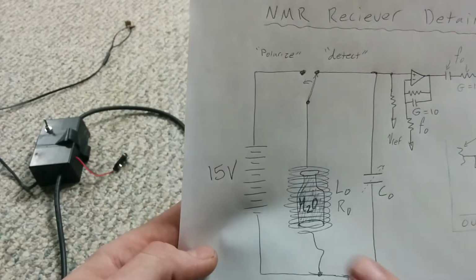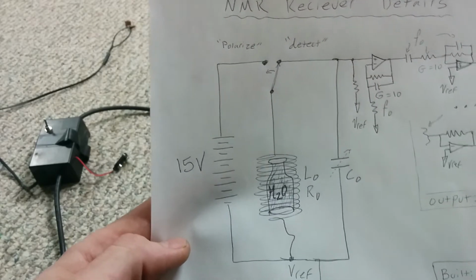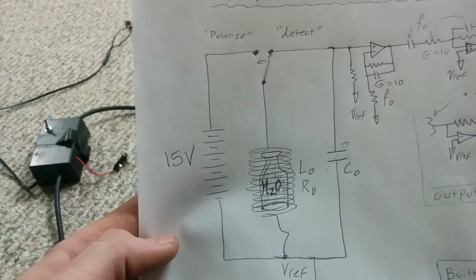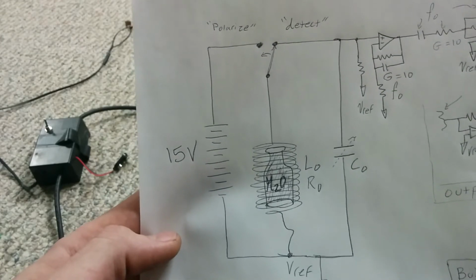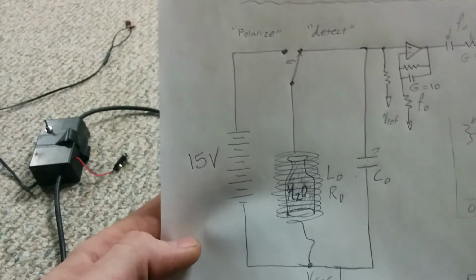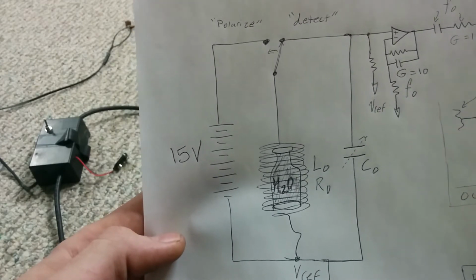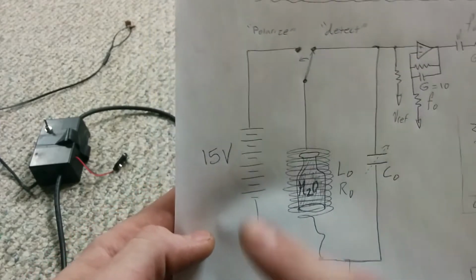And so this LC resonator forms a Q of about 8. That's a computed value. I didn't measure that. I know the response of that LC is about a Q of 10. That's what I had estimated from seeing it on the scope, but I hadn't actually measured it. So it's computed as 8.5. What else is noteworthy there? I think that's good. That's the basics of the big course elements.